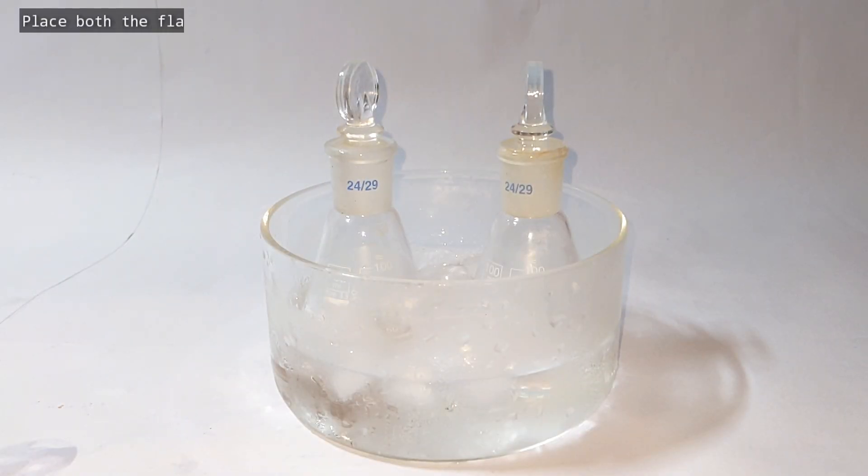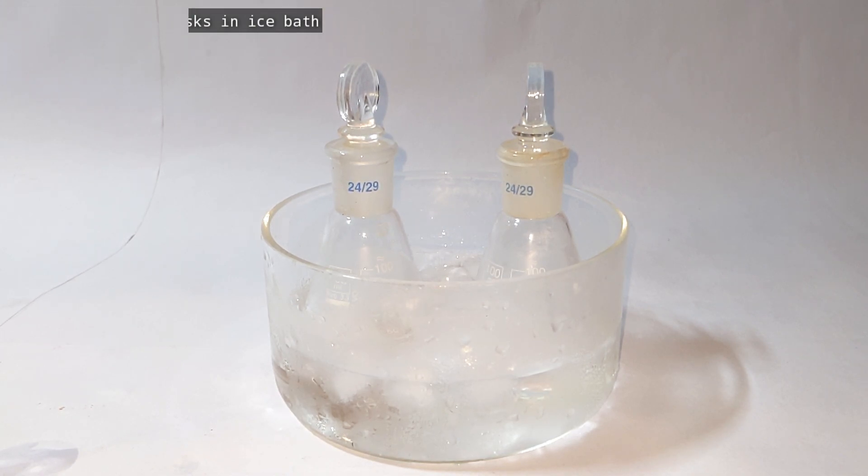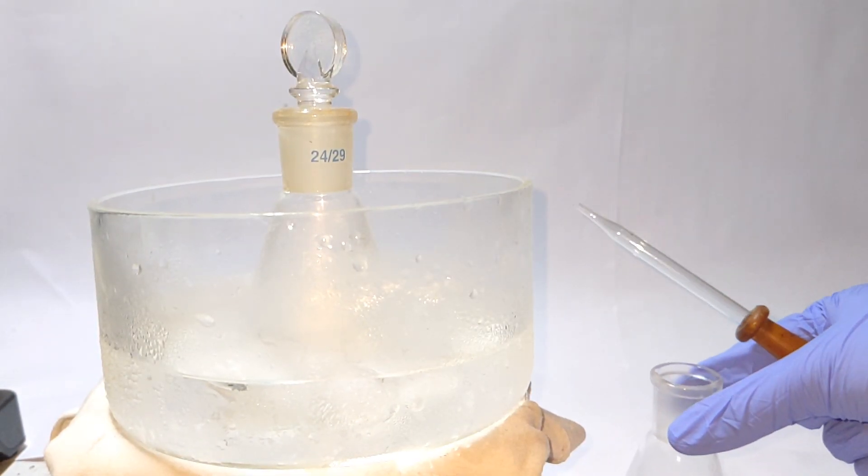Now we cool both the flasks in an ice bath. Actually water could be more than enough as in the next step of nitration the temperature has to be prevented only from rising more than 50 degrees Celsius.